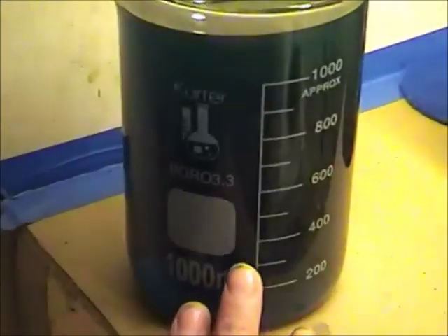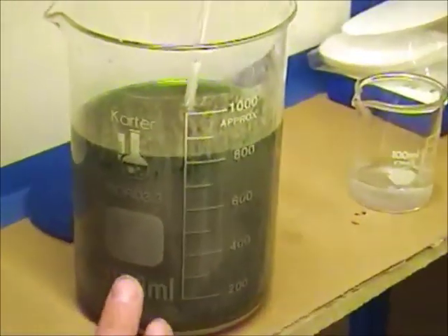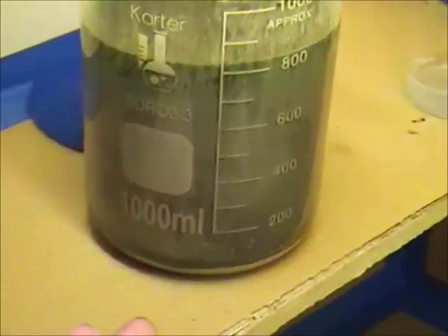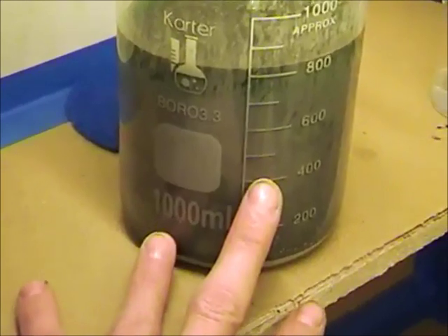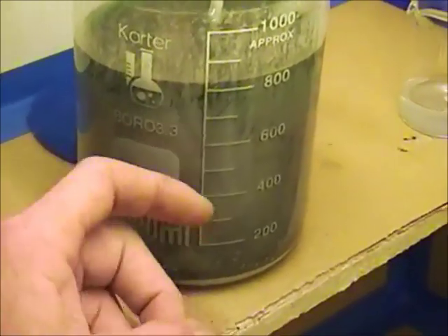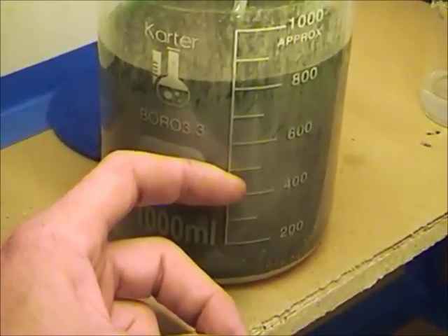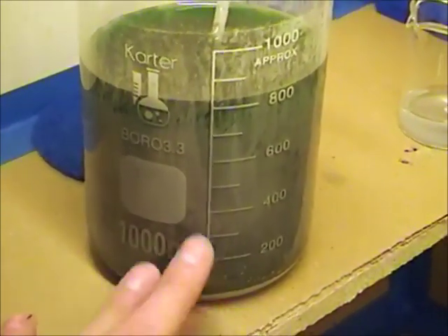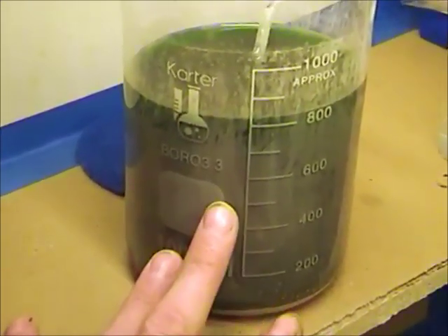This is one that I've filtered. All of my beakers silvered up on me last night, and these beakers were totally clean — I made sure they were copacetically clean before I precipitated it. A lot of times when you're gold refining, if you don't have a clean vessel, you'll have gold precipitate on the surface of the beaker. Silver seems to have an affinity for glass. Don't forget, that's what our mirrors used to be made out of — you would take silver and apply it to the back of a sheet of glass, and the reflective properties of silver made it a mirror.